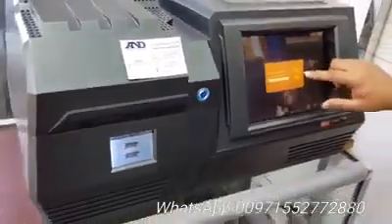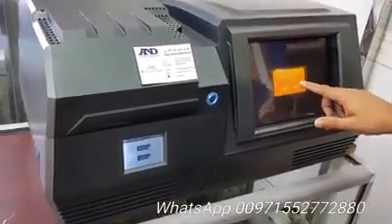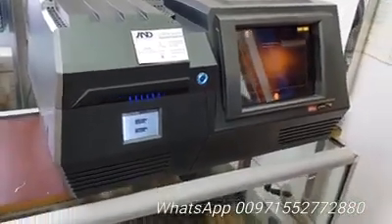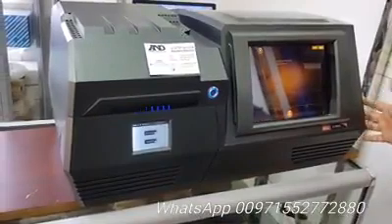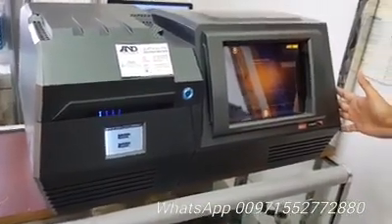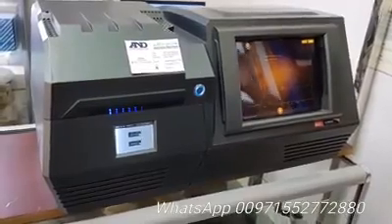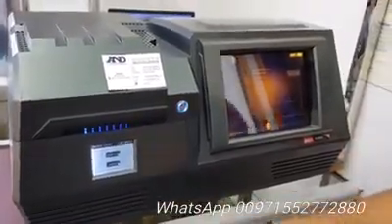Just simply press play and it will ask if you want to overwrite the file — that's fine. This is Windows XP, so you can attach any printer with it to get the result. For the calibration or adjustment of this machine we have our silver over here.